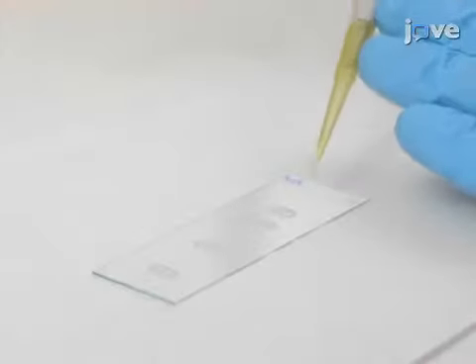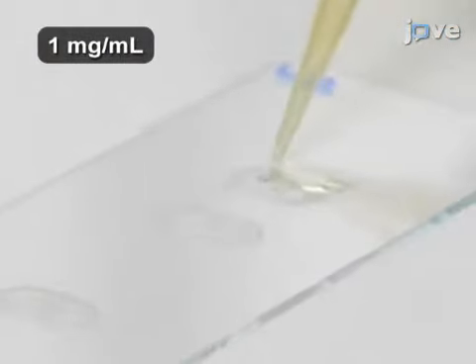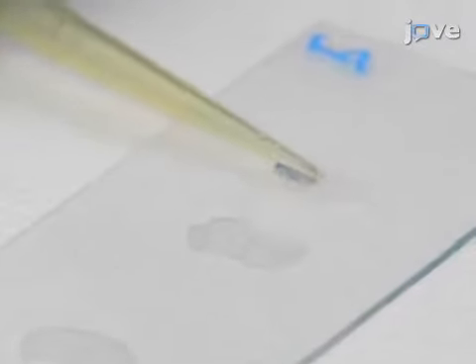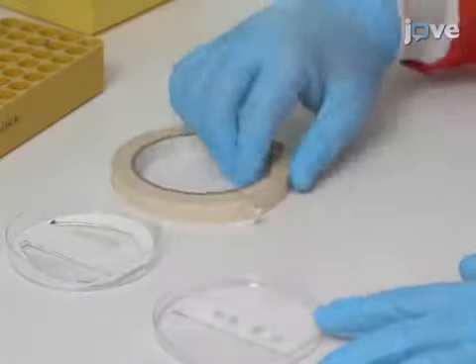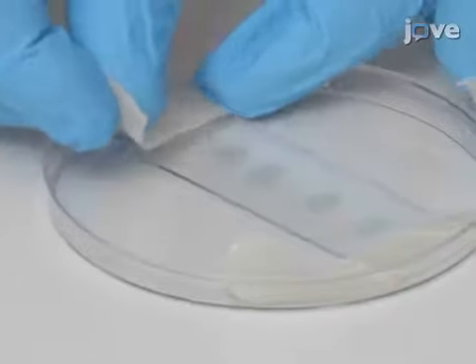Once hydrolyzed, coat the samples with 10 microliters of trypsin solution in ultra-pure water by first pipetting 10 microliters of the solution onto the edge of the tissue section. Then, using the same pipette tip, drag the droplet across the whole surface of the tissue under surface tension. After allowing the samples to dry at ambient temperature, mount them inside the top of the previously constructed vapor chamber with autoclave tape on either edge of the slide.